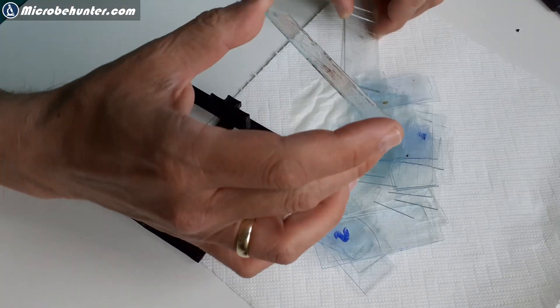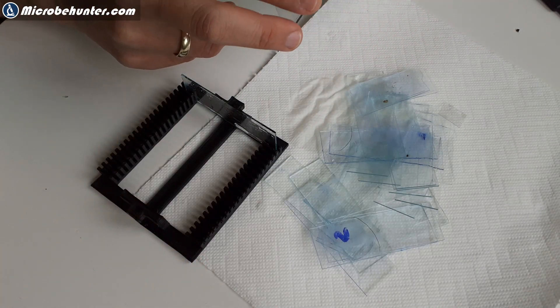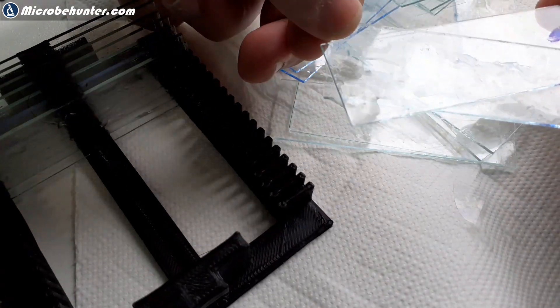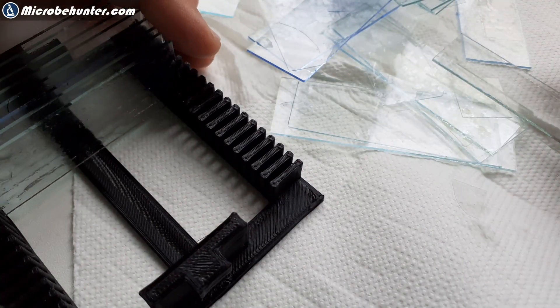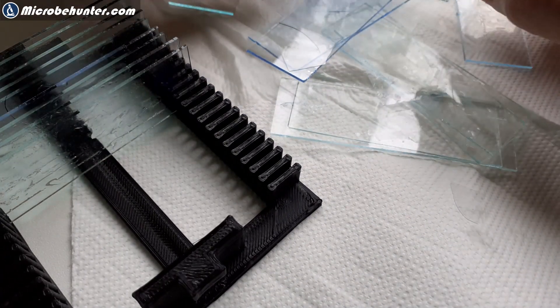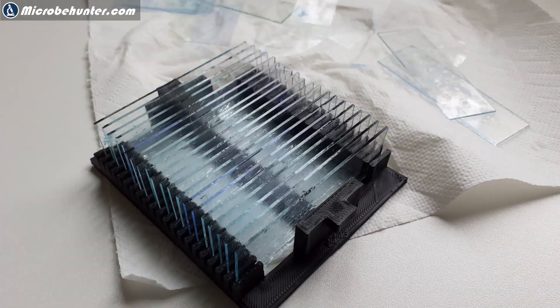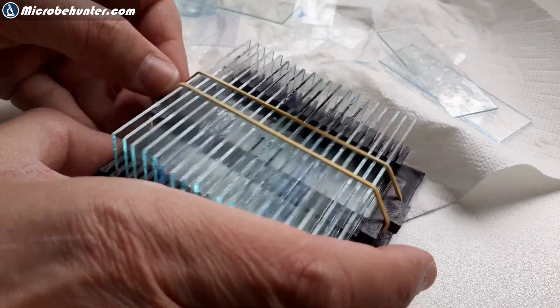I first had to remove all of the cover glasses because I did not want them flying around in the dishwasher. I sorted in all of the slides and found that two millimeters of spacing might not quite be enough, but I said I'd give it a try anyway. Some of those slides had been placed in water to make it easier to remove the cover glasses, so I soaked them for some time and exchanged the water — but essentially they were not really clean yet.